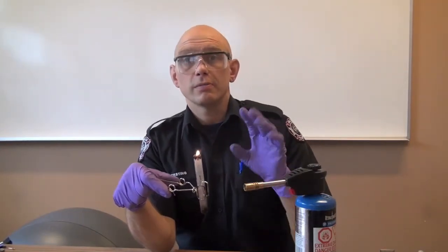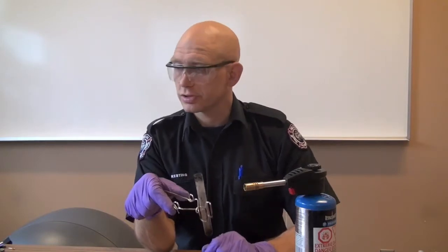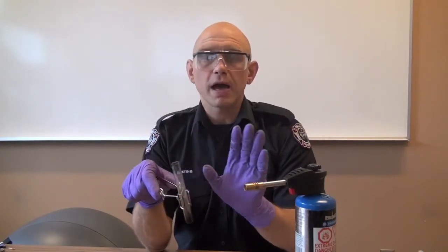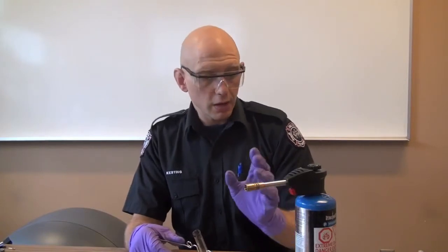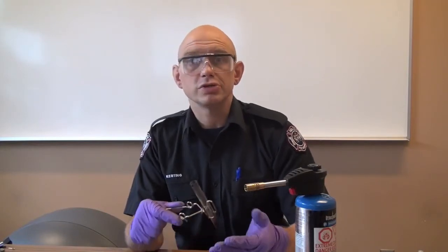A very important thing — be careful, only do this if you've been trained. Wear your glasses, do this away from the main area, not by the whole big shoe polish truck that you could light on fire and create a big problem. If this burns really energetically and it starts popping or exploding, stop everything. You might have an explosive — back off, call the bomb squad, call in the big guns; this is now beyond your ability to handle. Just to be clear: with the burn test, you don't have wood in there because you're seeing if the material itself will burn. With the hot tube test, you do have wood in there because you're providing a fuel in case it's an oxidizer. With the burn test, you just have the material by itself, heating it up and trying to burn the vapors coming off that solid material.